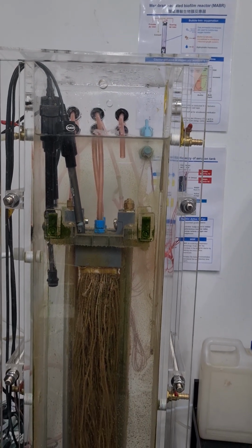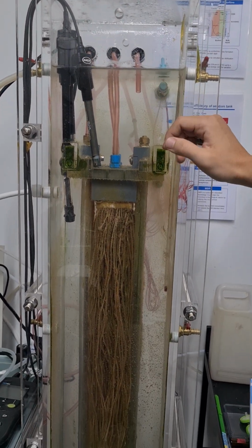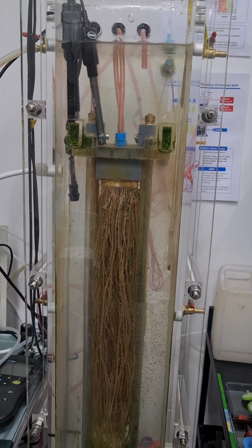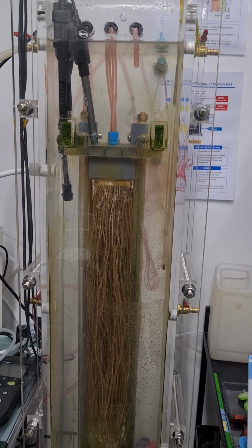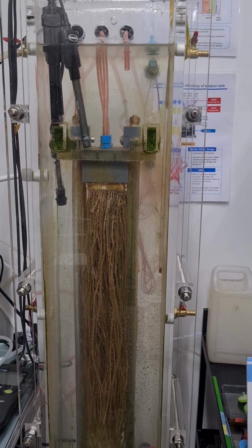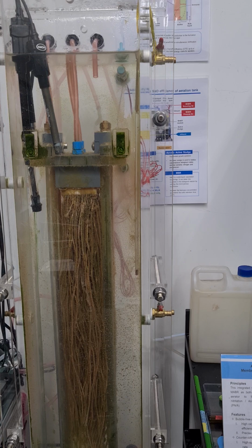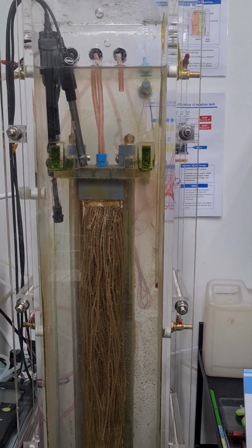Okay. Yes. And also no COD in the water. So the nitrogen removal solely depends on the Anammox process, but no denitrification. In this case, we want to explore the relationship between oxygen loading or oxygen supply and microbial activity. So I think it's more like an exploration of fundamentals, not a kind of application.